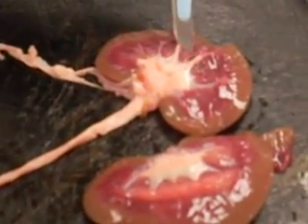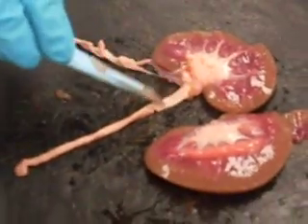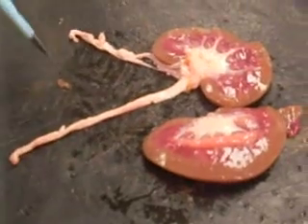The renal pelvis. The renal pelvis is this inner area right here. The renal pyramid. The renal pyramids are these red parts that are in between, like little triangles in between the columns. And that brings us to the ureter. And then here's the ureter. The fibrous capsule, which goes around the whole outside. Fibrous capsule.